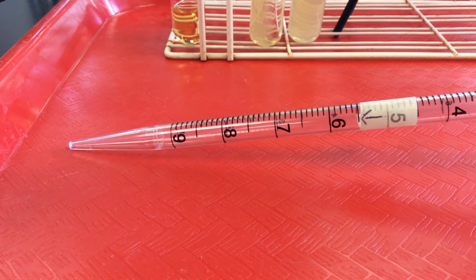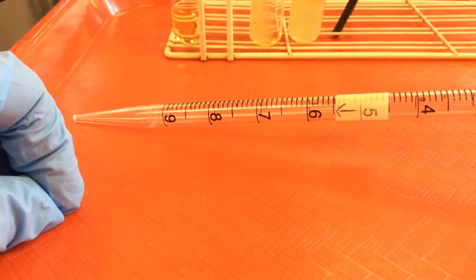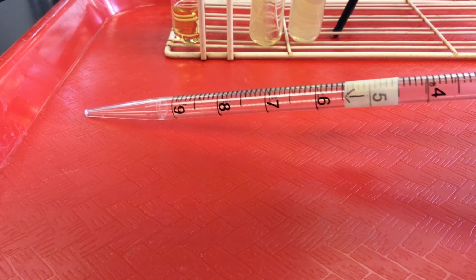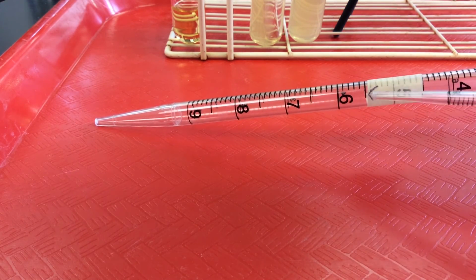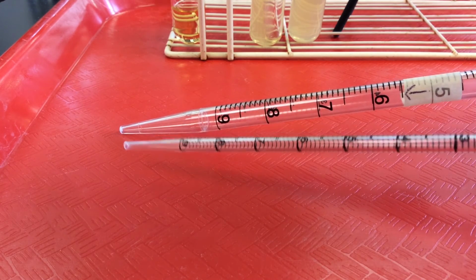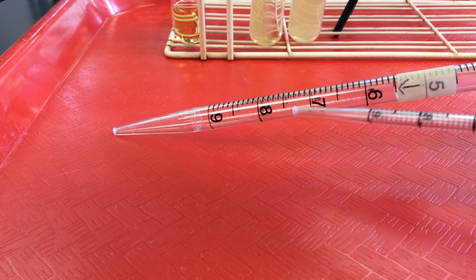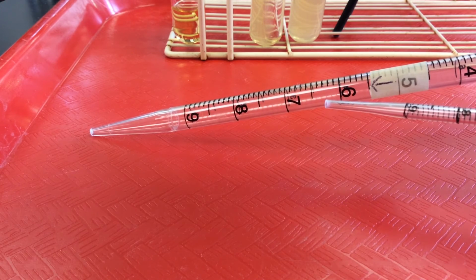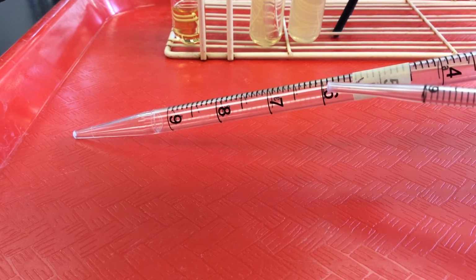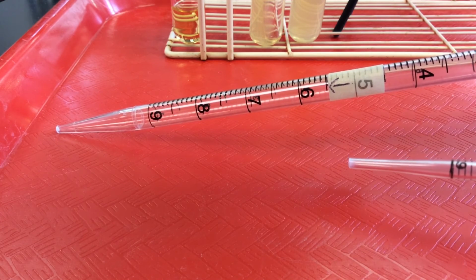This might be an example, say, on a lab practical. So we might ask you, what's the volume if you drew up fluid from the very tip up to where this tape arrow is? So we can count. We want to include the volume at the very tip. So this would be 1 mil, 2 mils, 3 mils, 4 mils. And we want to remember that the smaller units are 1/10 mils. So 4 mils, 0.1, 2, 3, 4, 5. So 4.5 mils would be our answer.